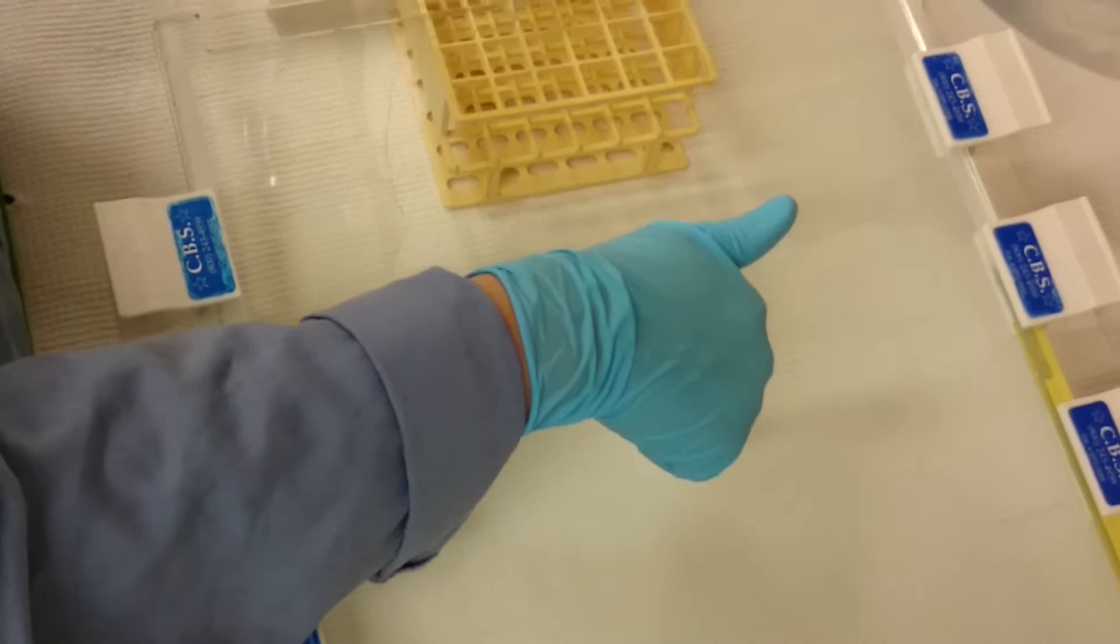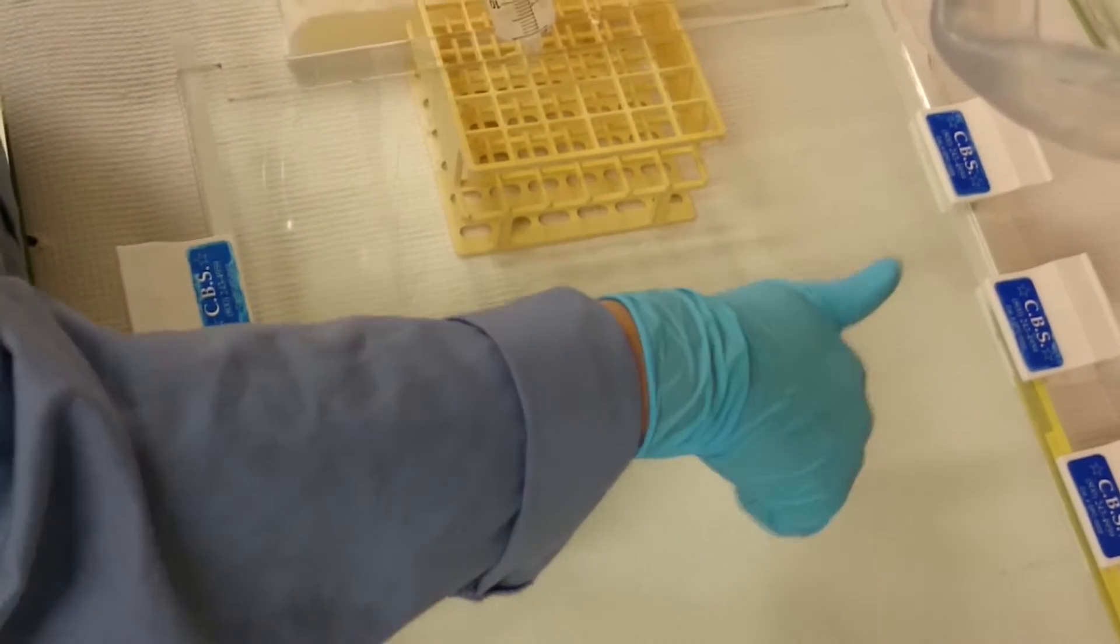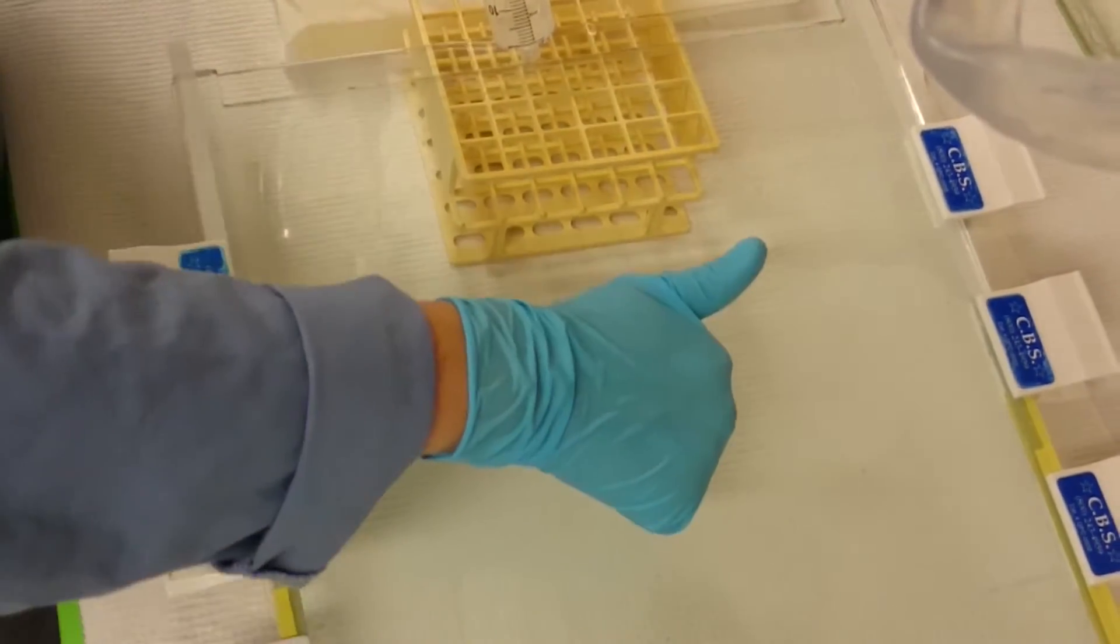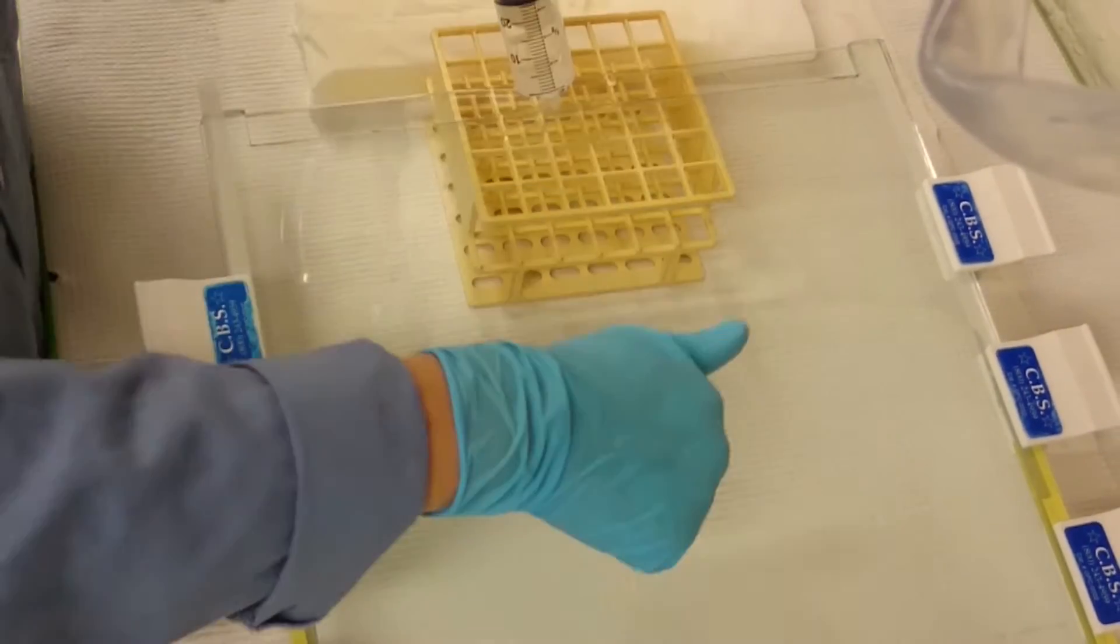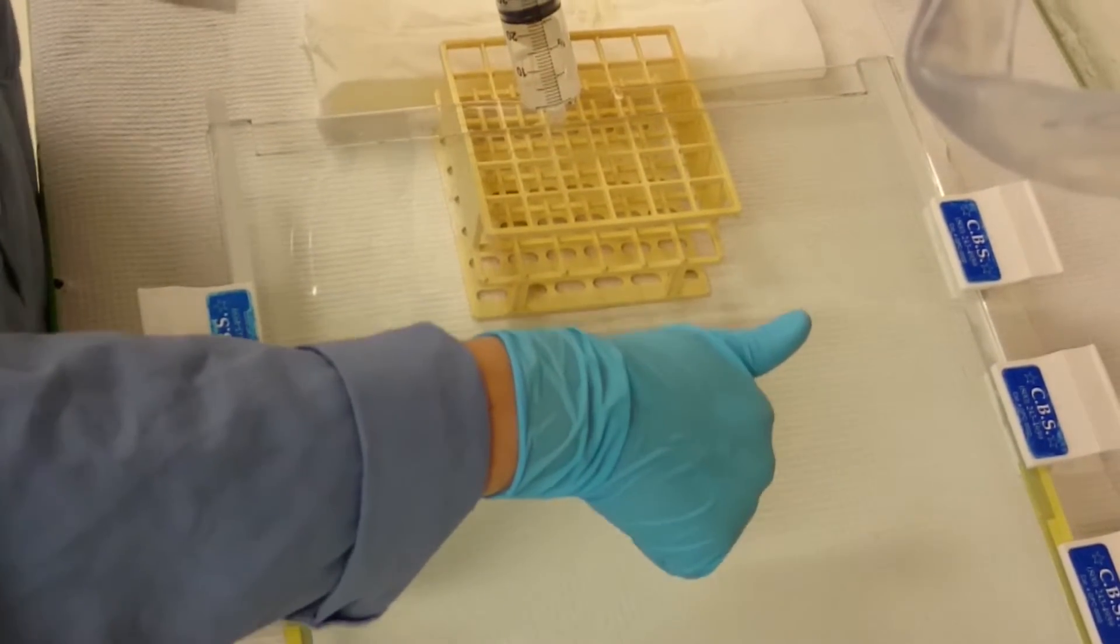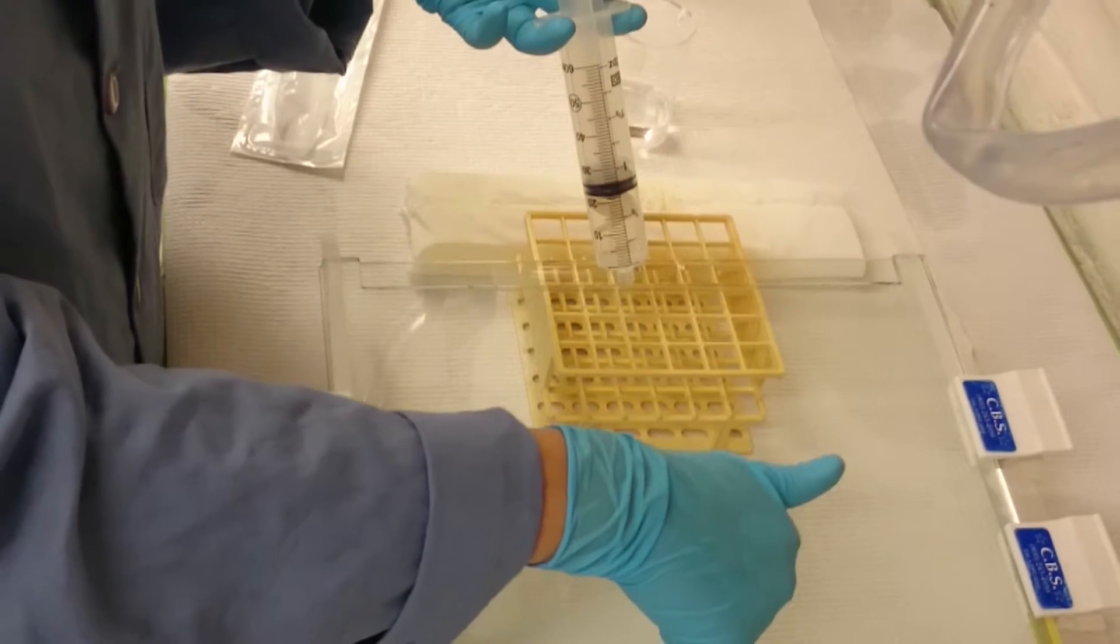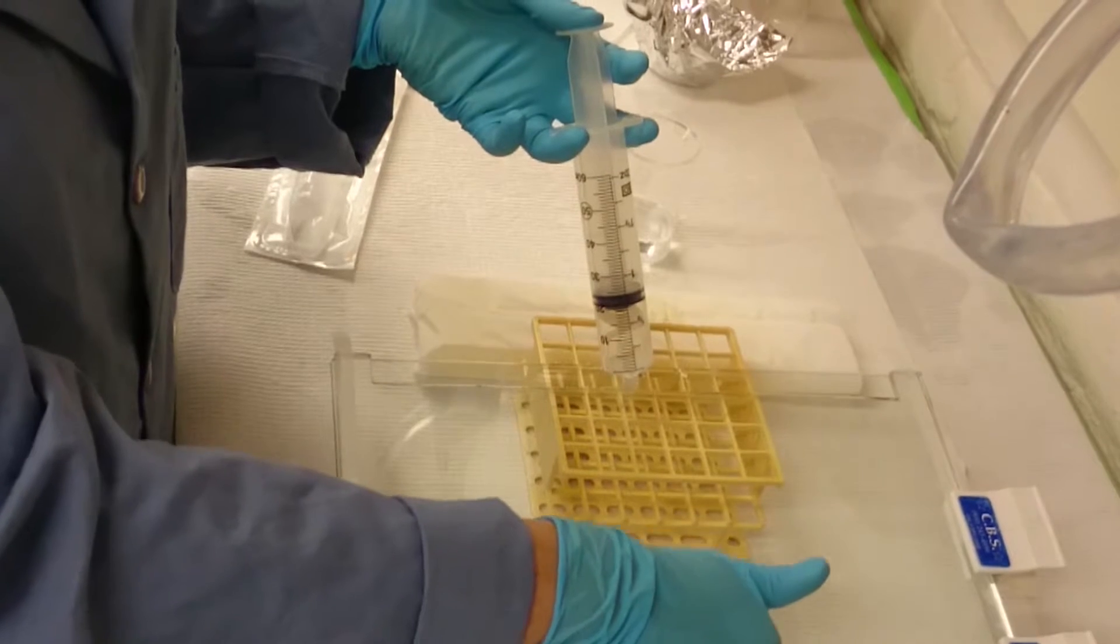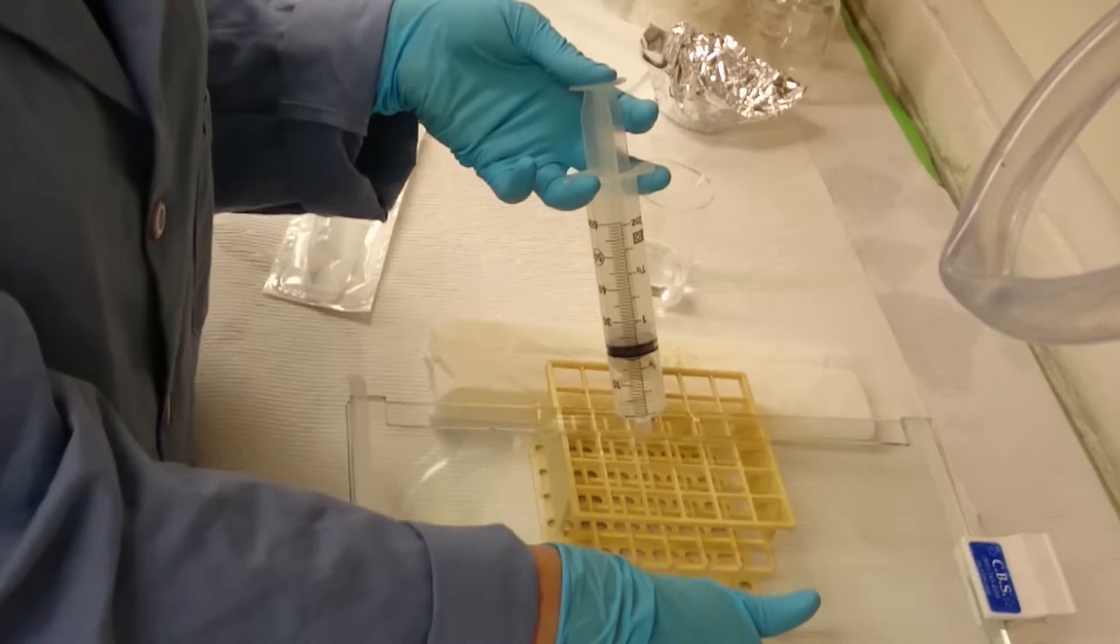One thing that I learned that was surprising because it goes counter to everything that I read is that I actually get better resolution if I leave the samples in the well for just a minute or so after loading them. So prevailing wisdom says that you should load and start as fast as you can, which makes sense because your sample will diffuse away eventually. But what I've found has a bigger impact on my resolution is the small tail of sample.